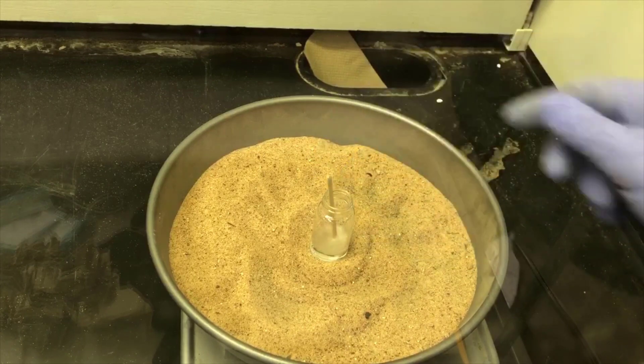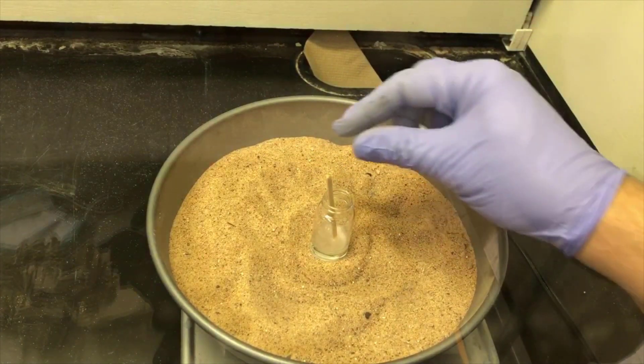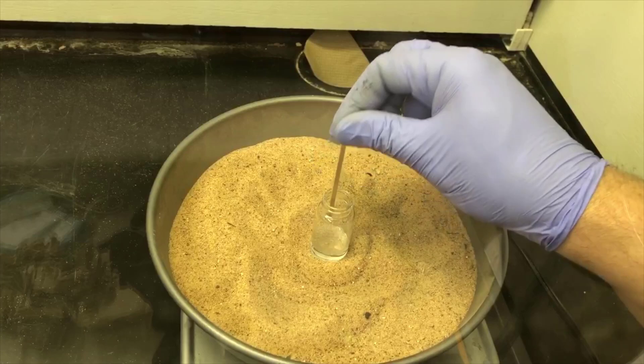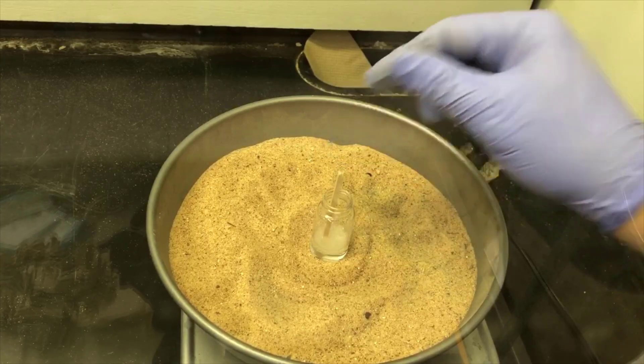I put it back in, and the boiling resumes. The stick functions like boiling chips. It's just a whole lot easier to remove a stick in the end than boiling chips.